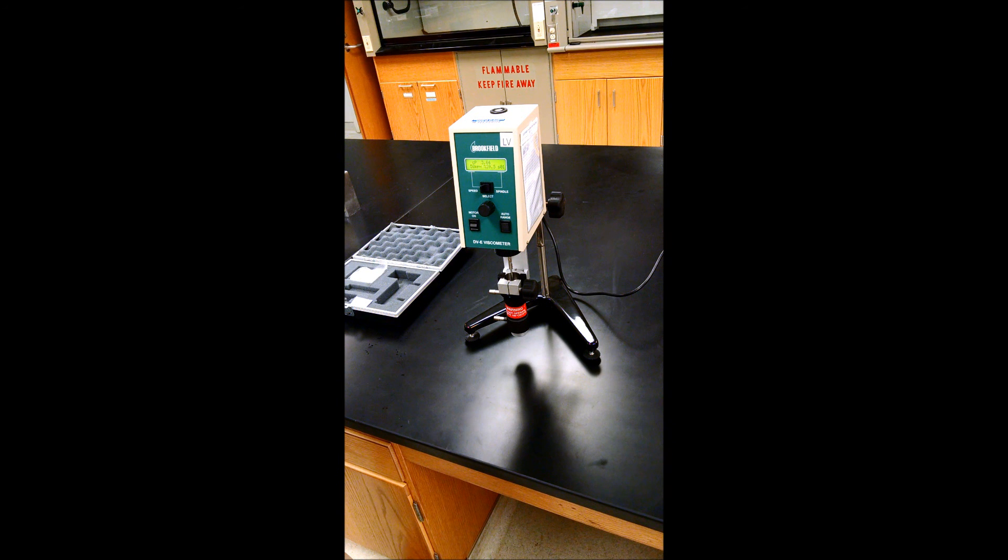Well, it's going to take longer to settle down. So that is finally settling down, so now we can take a measurement. And in your handout it says how long you should let it run before you take the measurement.